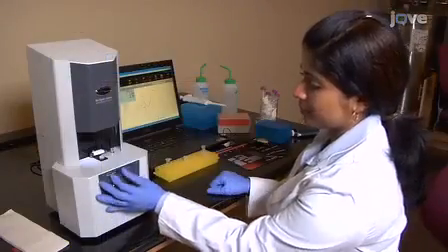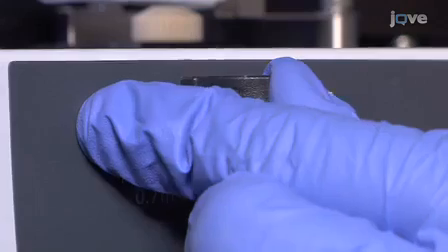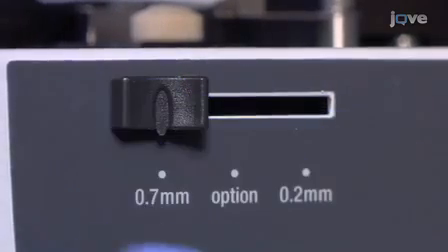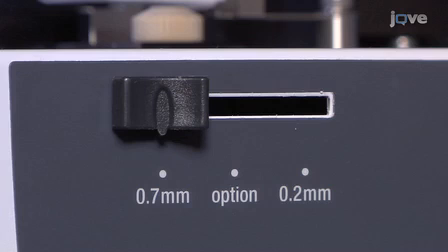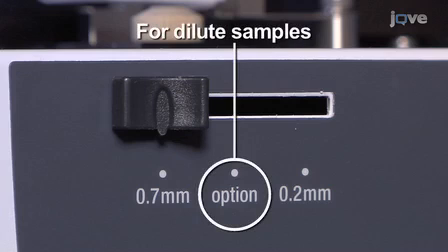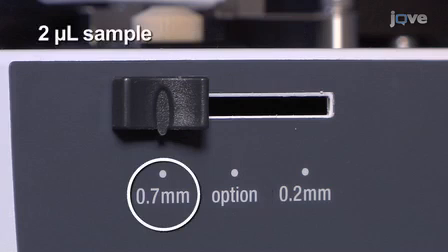Next, select the path length on the path length slider. Three options are available. For microliter volume samples, 0.2 mm or 0.7 mm can be used, and for dilute samples, there is an option to use a 5 mm path length cuvette. In this demonstration, 0.7 mm is selected for measuring a 2 microliter sample. All calculations are based on the path length selected.